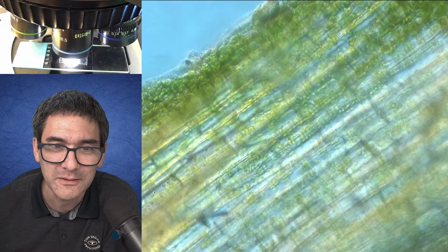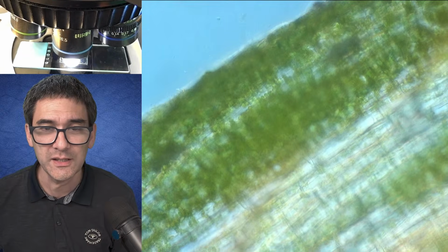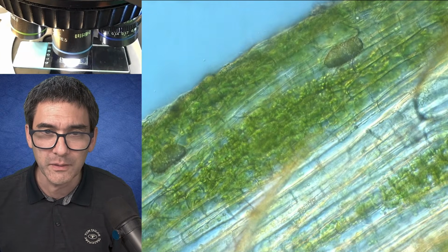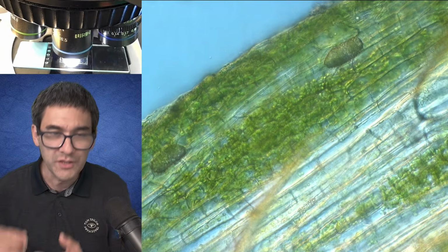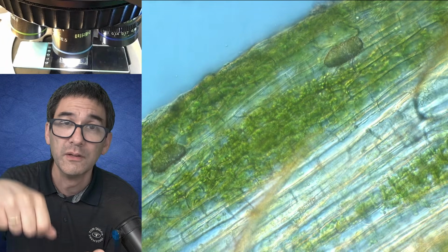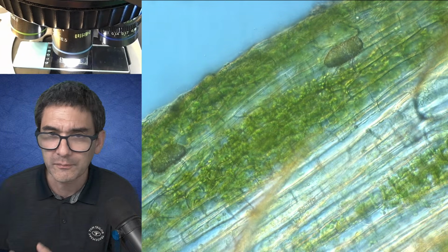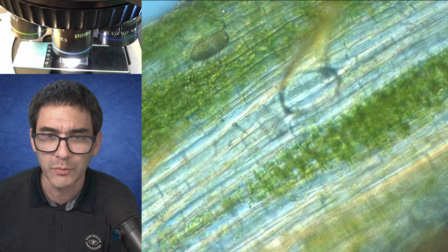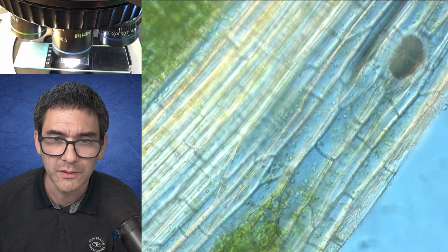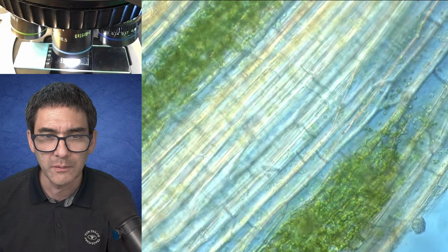And look at the green chloroplasts. So generally, you see that very briefly, a nice easy way: you just take a small sample of the plant, and then you simply compress it and squash it flat. So without cutting, this way we're also able to see quite a bit here. So here the cells are quite nicely visible. So let's move on.